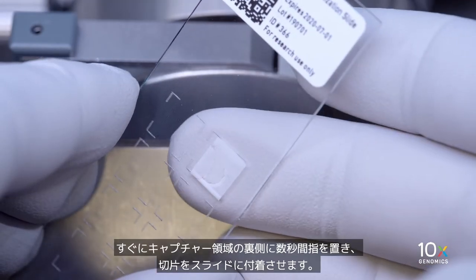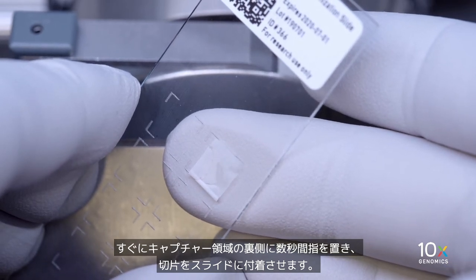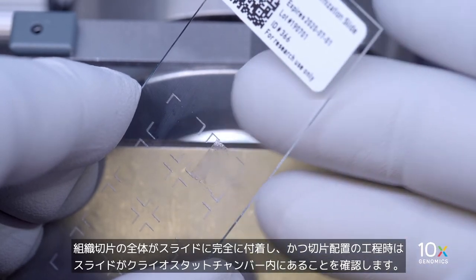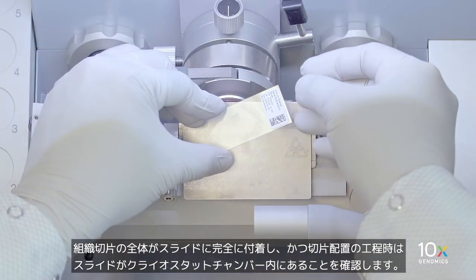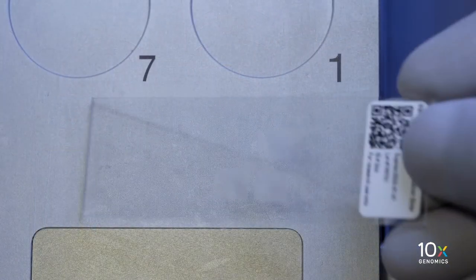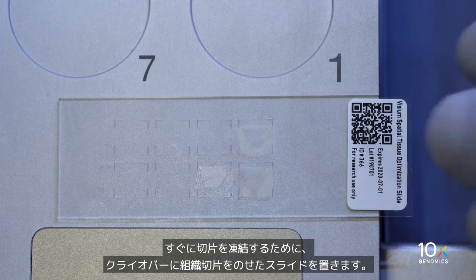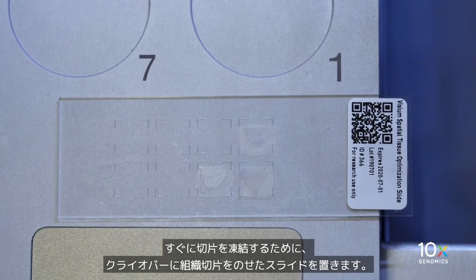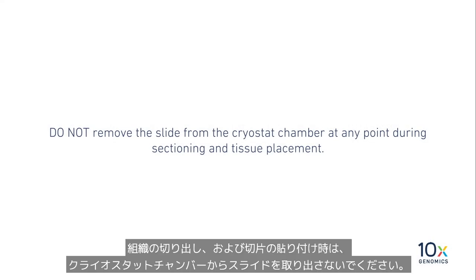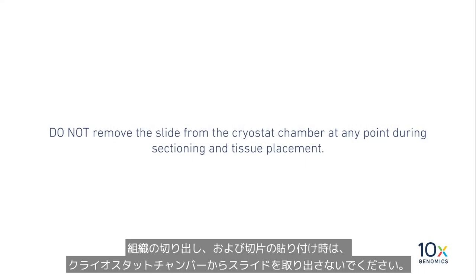Immediately place a finger on the back of the capture area of the slide for a few seconds. This will allow the section to adhere to the slide. Ensure that the entire tissue section is fully adhered to the slide and that the slide remains inside the cryostat chamber throughout section placement. Immediately place the slide with the tissue section on the cryobar to freeze the section. Do not remove the slide from the cryostat chamber at any point during sectioning and tissue placement.